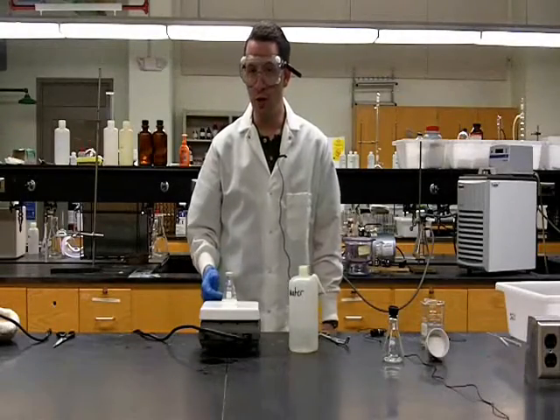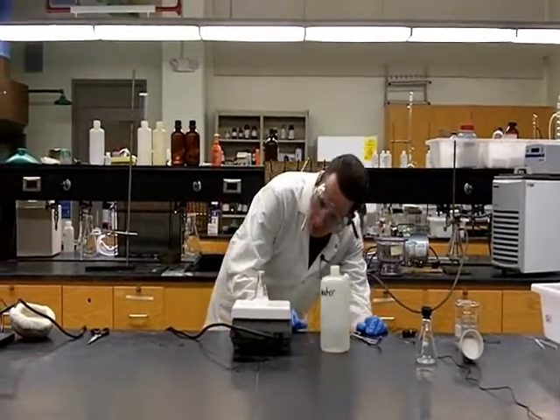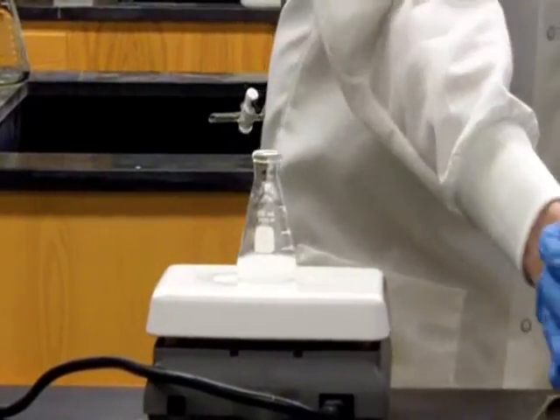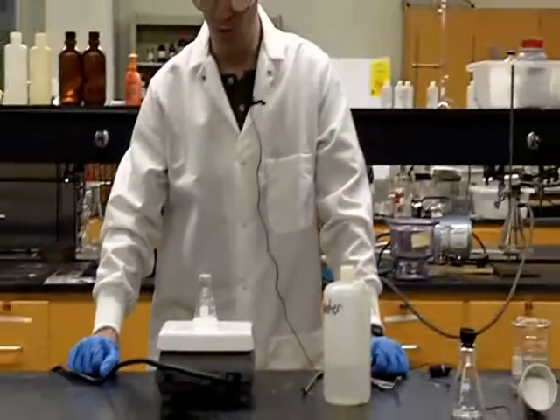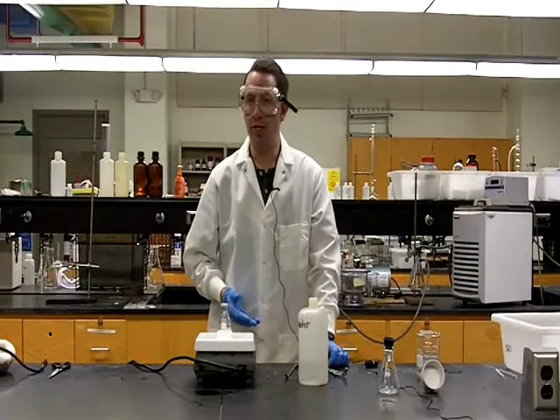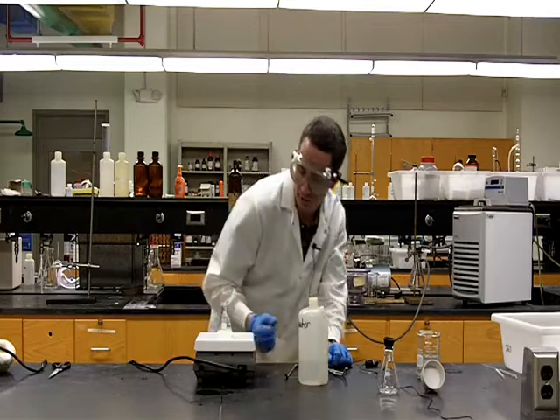We can now see our water has come to a boil, but if we look at our solution we can see that it's still somewhat cloudy, meaning that not all of the benzoic acid has dissolved. So at this point we're going to add a little bit more water, and again now we need to wait for that to come to a boil. It is very possible that when you add additional solvent that more solid is going to crystallize out because the solvent you're adding is not yet heated, and so you're cooling down the temperature of the overall solution.